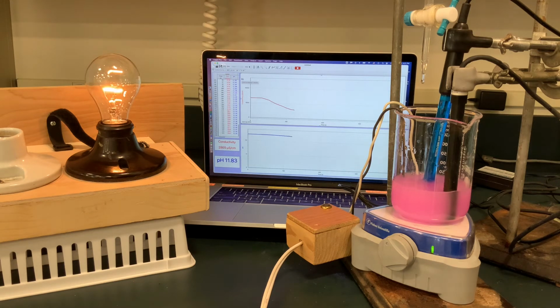as well as the brightness of the light bulb, which of course has probes in the solution detecting the conductivity of the solution. Two reactions are happening simultaneously, as they ask in the question, that is causing the conductivity to drop. Keep your eye on that light bulb. It's pretty dramatic coming up as we start to see it really fade away as the conductivity graph in the background is starting to bottom out.